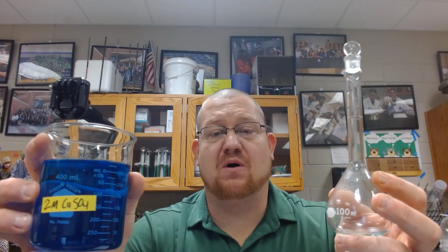This is the live labeling part 2 introduction video where we're going to make a 100 milliliter copper sulfate solution using a 2 molar stock concentration. The purpose of this lab is to get hands-on experience with creating a solution using the dilution formula from a stock solution. In this case, we will be watering it down, diluting it to a specified concentration that is specified by our answer sheet.